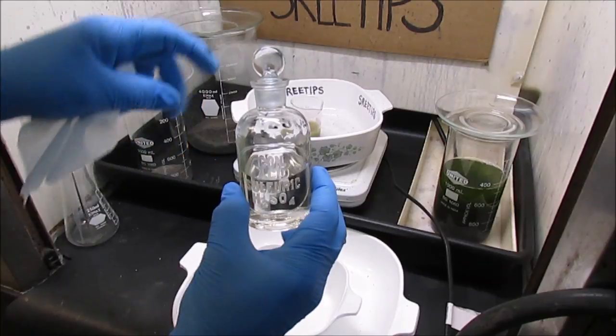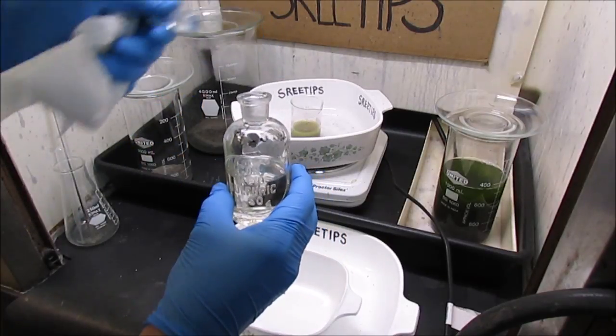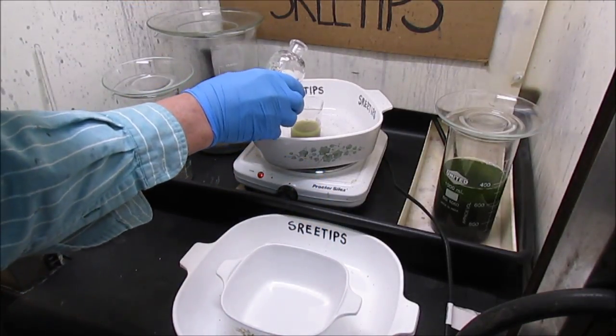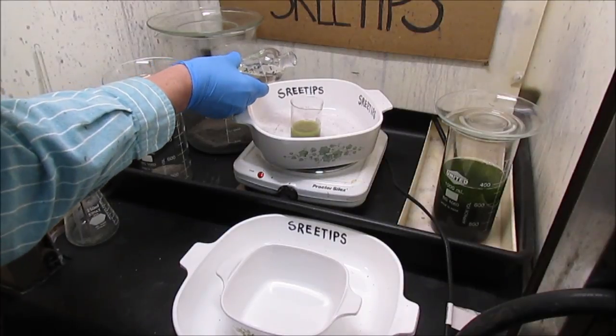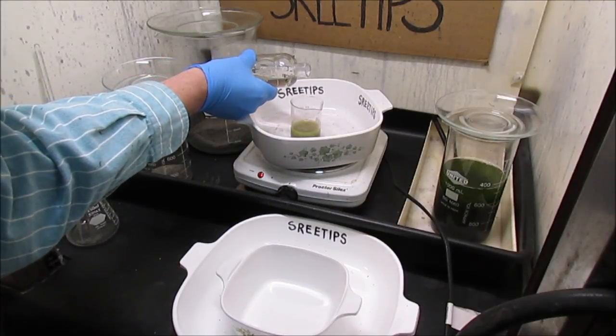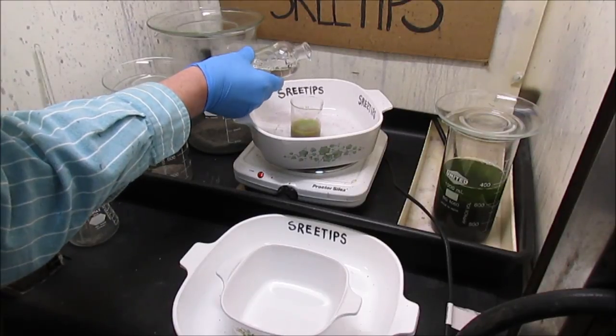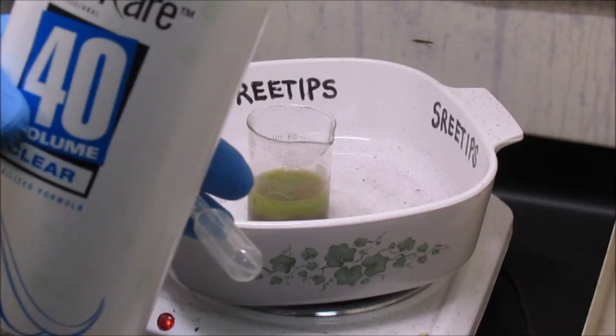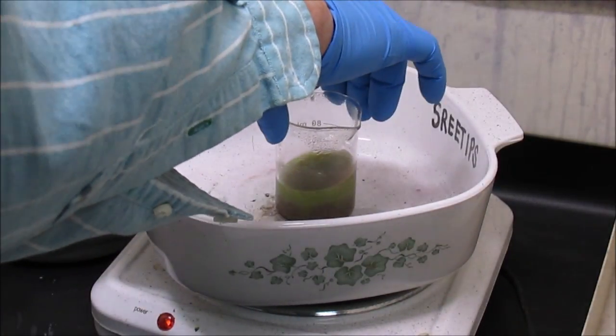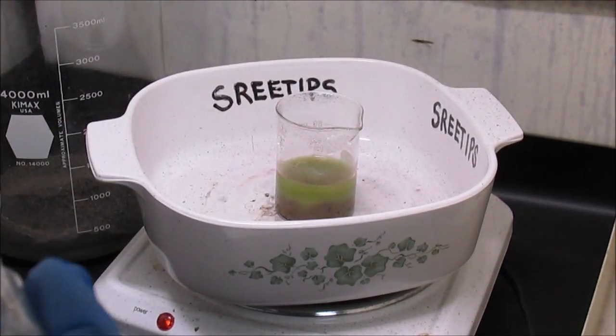I'm going to add a touch more concentrated sulfuric acid here, just a little bit, carefully. I'm going to add a little bit more hydrogen peroxide here and see if we can get it to do something.